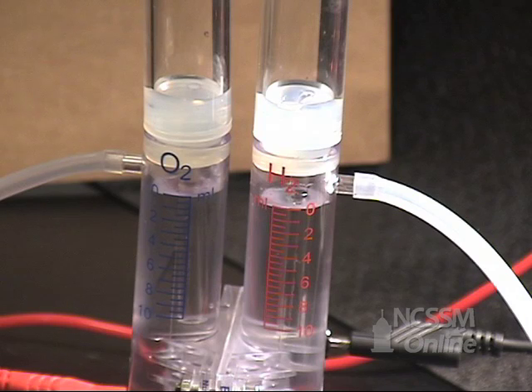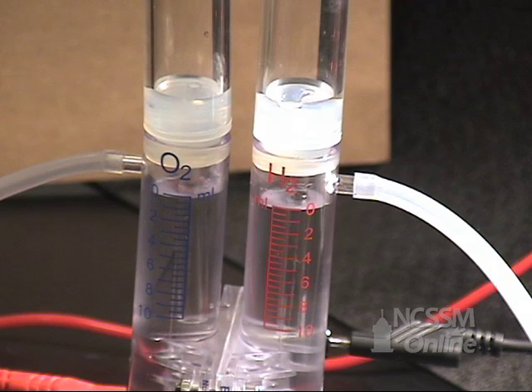You can almost see that it's a two to one bubbles produced for hydrogen, but we're going to continue this for about four or five minutes.